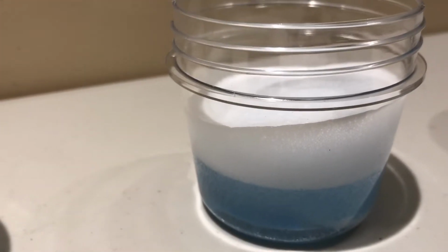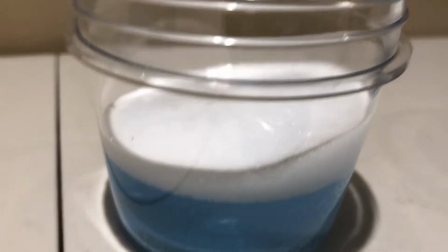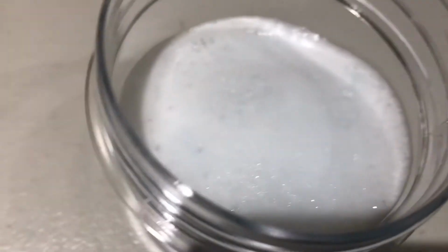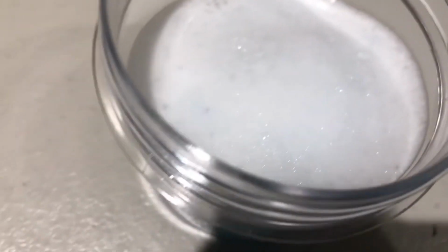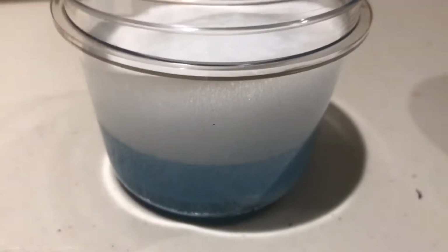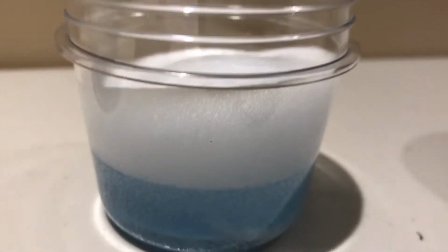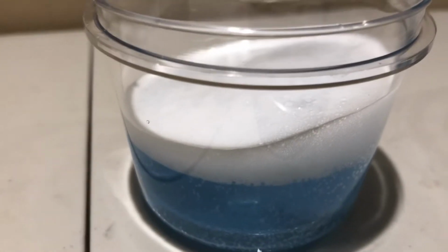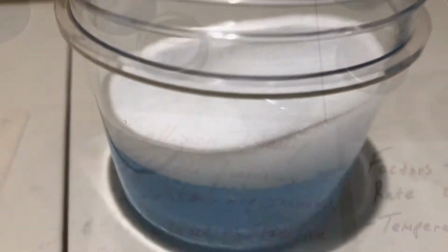You see, you got more bubbles. If you notice, I'm doing it like this. Look at the height of those bubbles versus the height of those, okay. So you saw a significant difference in height. So yeah, you could pretty much say that the higher concentration definitely is much more rapid. It's evolving more bubbles than the lower concentration acid. Okay, so let's analyze why.